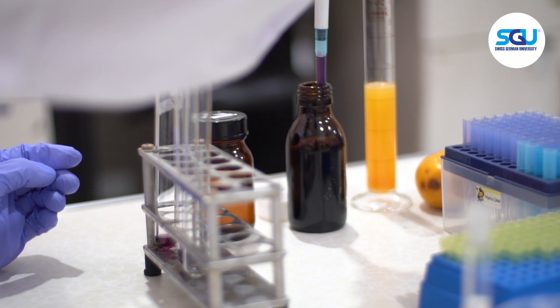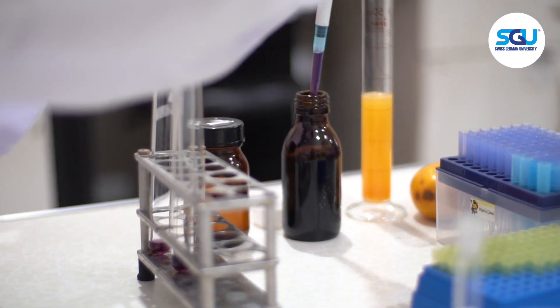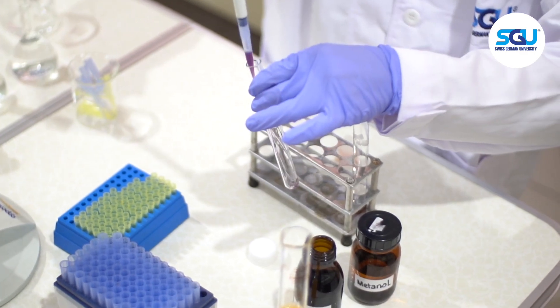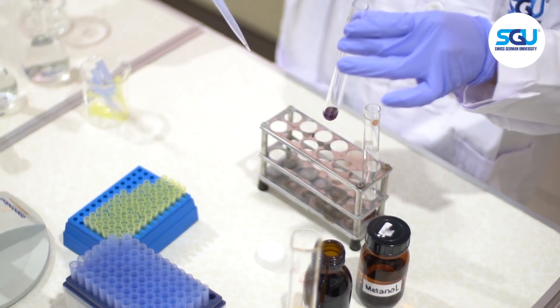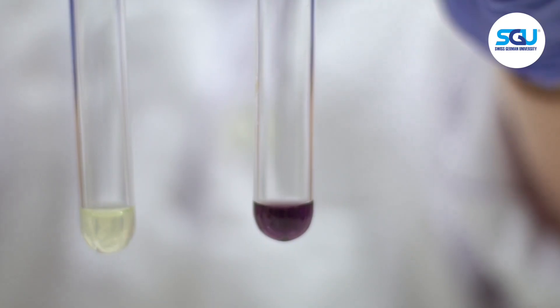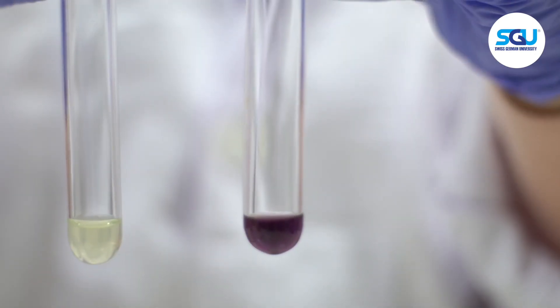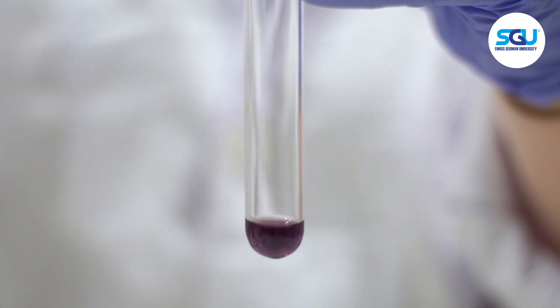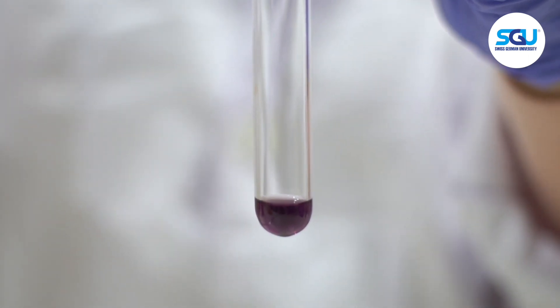Another solution of DPPH was transferred into a test tube. Now, the commercial vitamin C drink was also qualitatively tested. Like the orange fruit juice, the commercial vitamin C drink also turned the DPPH yellow.